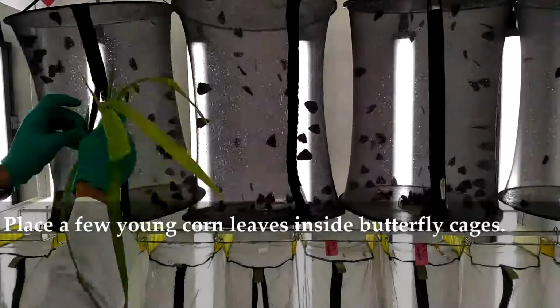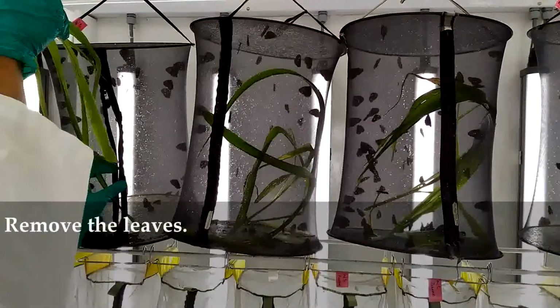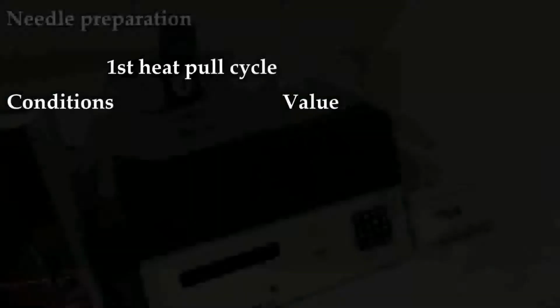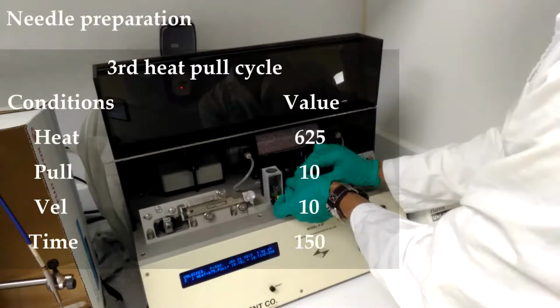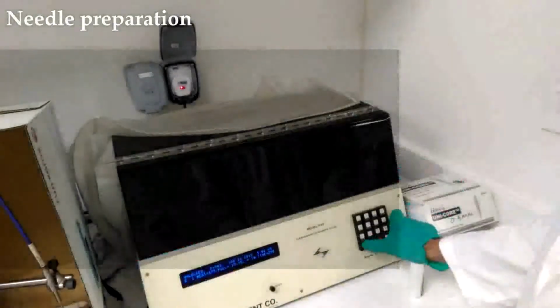Embryo collection. Place a few corn leaves inside butterfly cages and leave them for 30 minutes to 1 hour. Remove the leaves. Collect the embryos in a paper cup. Needle preparation. Set the conditions on the needle puller as shown on the screen. Place the needle in between the holders and start the heat pull cycle.